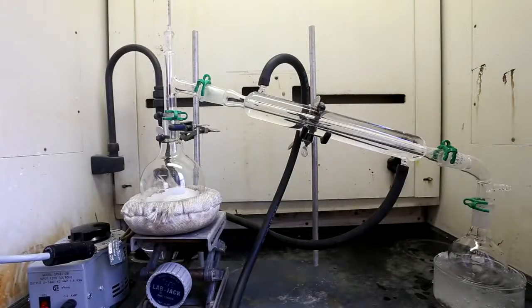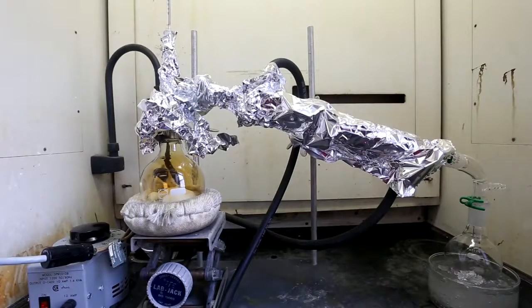This is just to show you what the entire distillation apparatus looked like. The distillation should not be done in direct sunlight, and you can cover it with aluminum foil to prevent the breakdown of some of the gases. You can put the receiving flask in an ice bath to keep the volatility of the distilled nitric acid as low as possible, but this is optional.